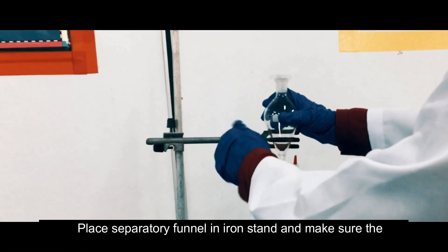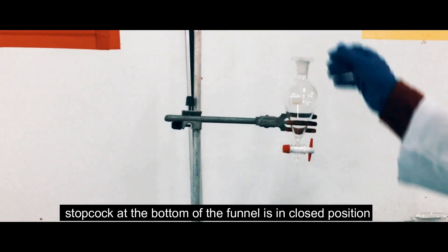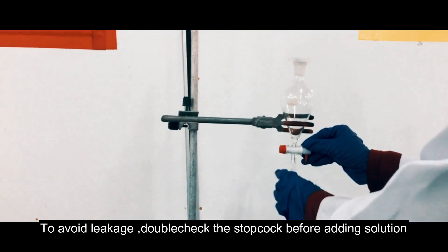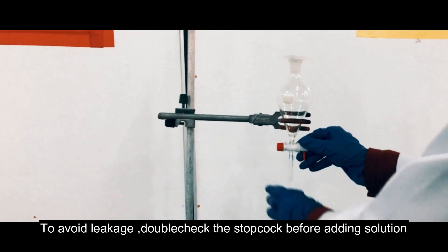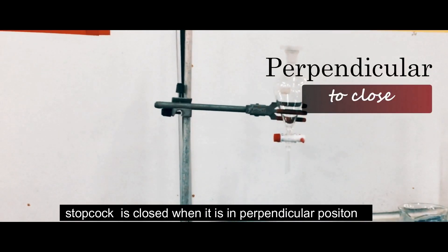Place separatory funnel in iron ring stand and make sure the stopcock at the bottom of funnel is in closed position to avoid leakage. Double check the stopcock before adding solution. Stopcock is closed when it is in perpendicular position.